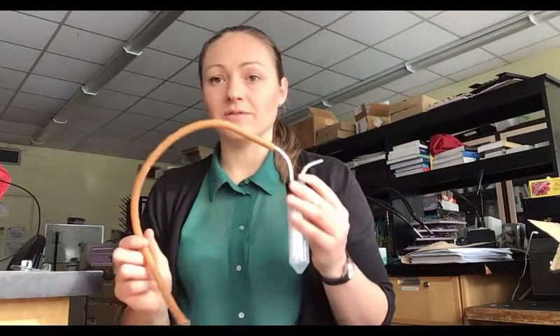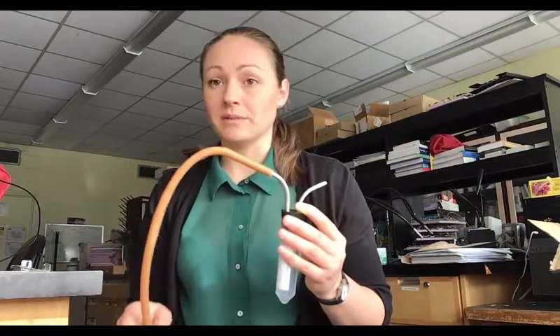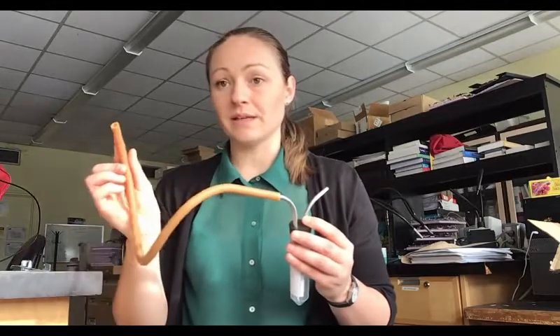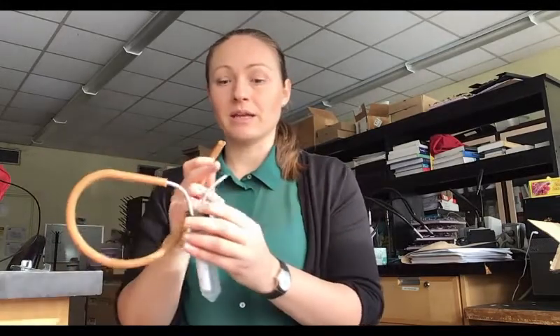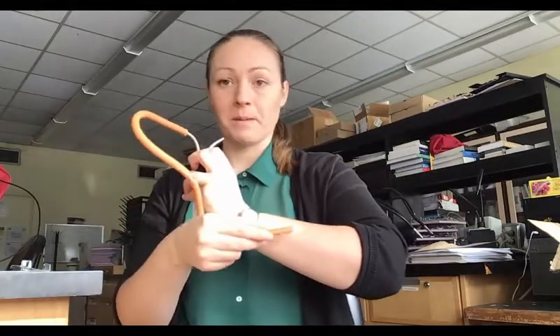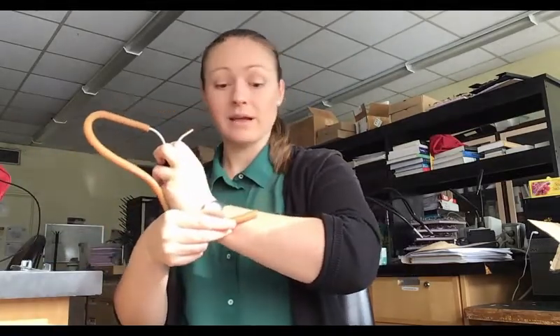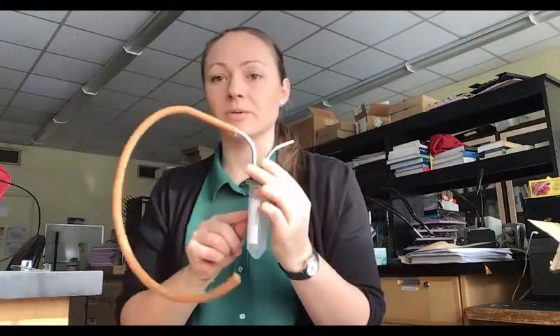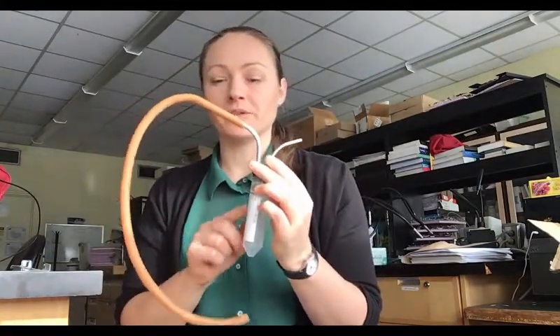Once you have the device ready, you're ready to collect mosquitoes. The way this works is you put this end up to the mosquito and inhale with this end. So if there's a mosquito on my arm, I put it up here, inhale, and the mosquito travels all the way up and gets stuck in this collection tube. That's where the mosquito samples will be.